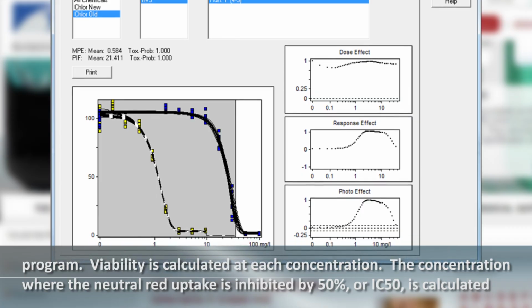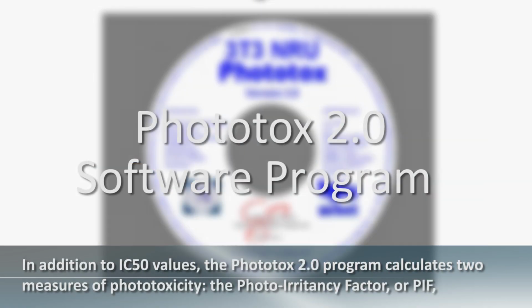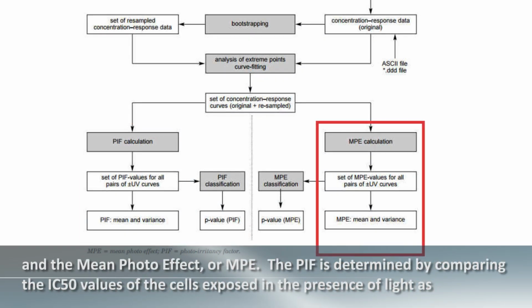The concentration where the neutral-red uptake is inhibited by 50%, or IC50, is calculated for both the light-exposed cell cultures and dark-exposed cell cultures. In addition to IC50 values, the Phototox 2.0 program calculates two measures of phototoxicity: the photoirritancy factor, or PIF, and the mean photo effect, or MPE.